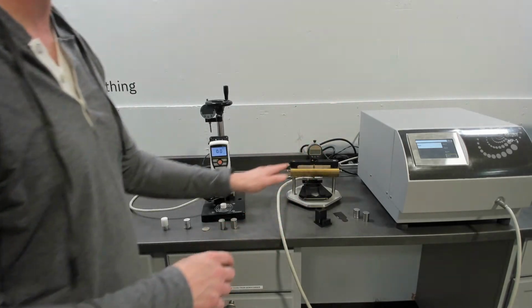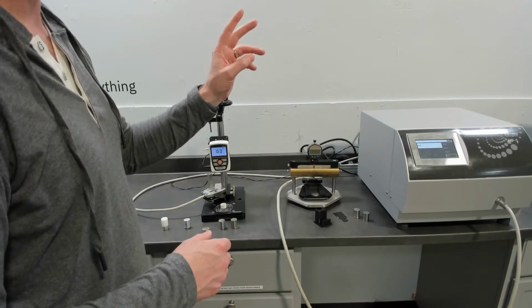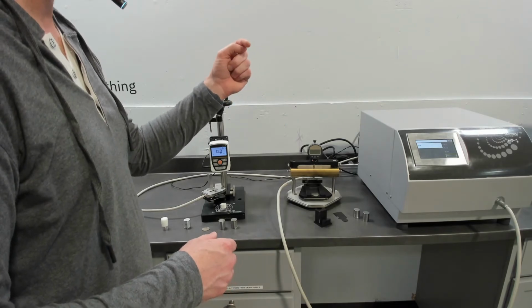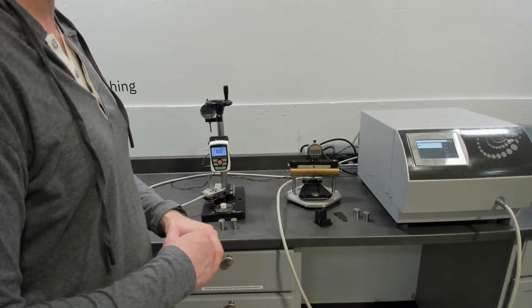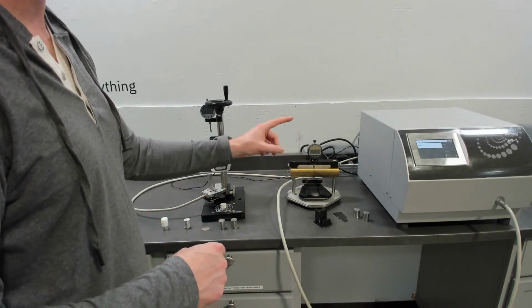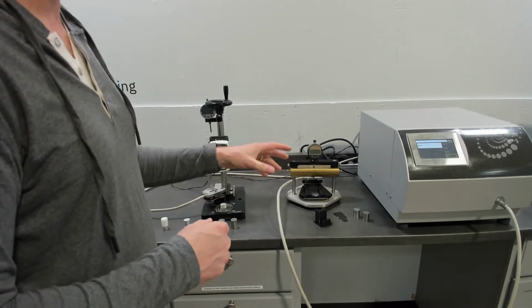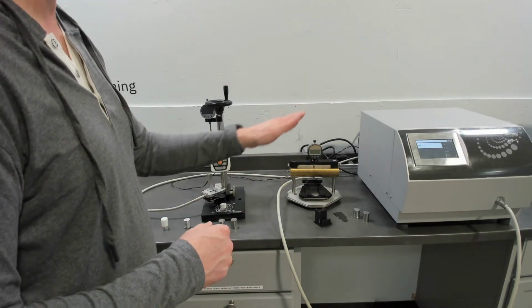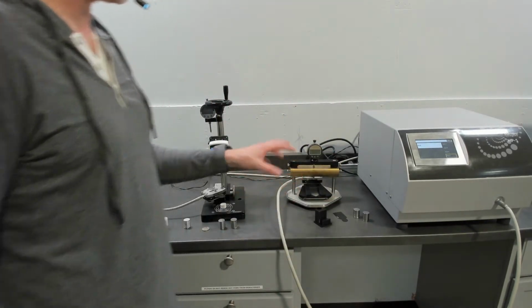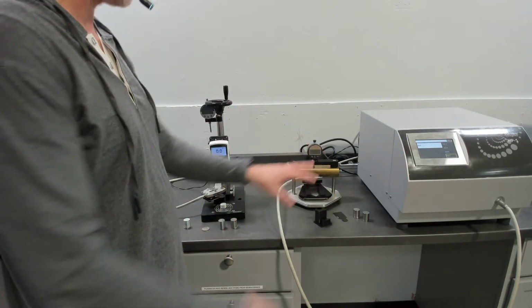and plot those, the 1 over the slope is your thermal conductivity, because with the additional layers, you're backing out the contact resistance between the samples and the 2 materials. That's for rigid materials. You get really high confidence values, because that change in resistance with thickness should be linear. So it's a little bit of a deeper explanation than I probably would have done normally on thin film, but everything I talk about here moves over here.